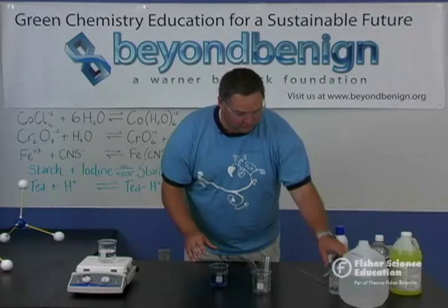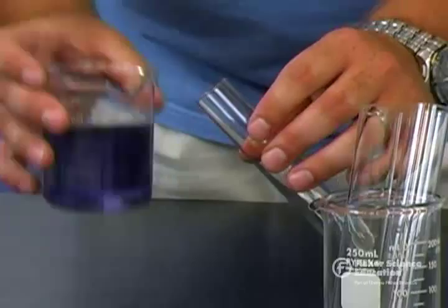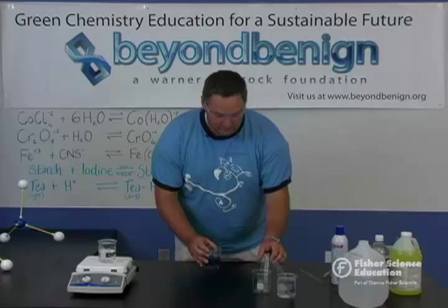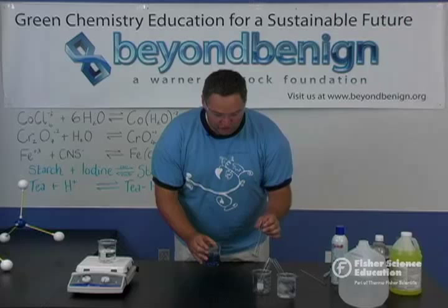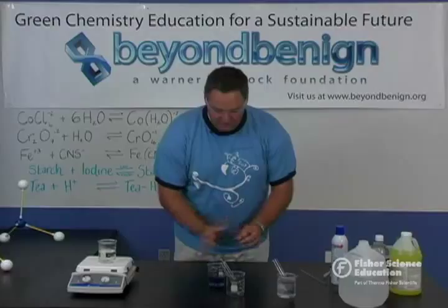We'll then take that solution and place it into three test tubes to produce three different samples. The first sample will be placed — about 30 milliliters — into an ice bath at approximately five degrees Celsius. The second solution will be our control, with approximately 30 milliliters maintained at room temperature.